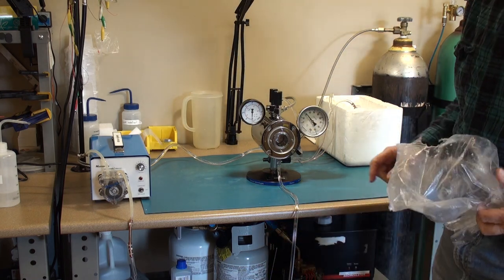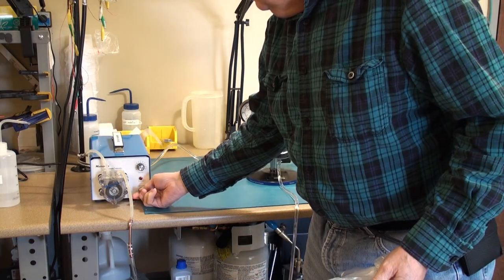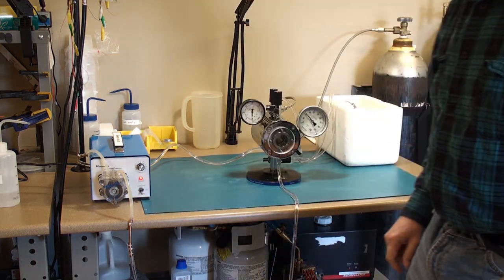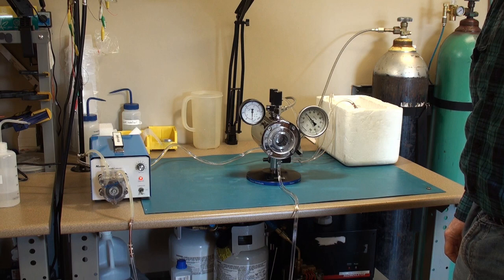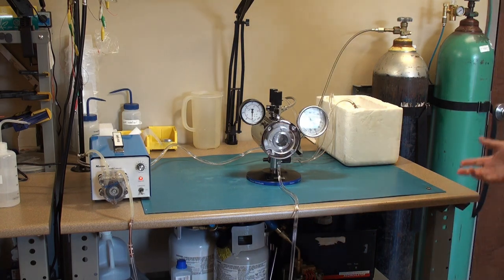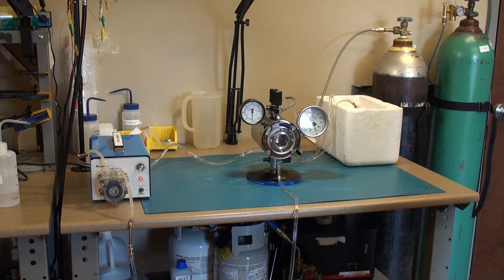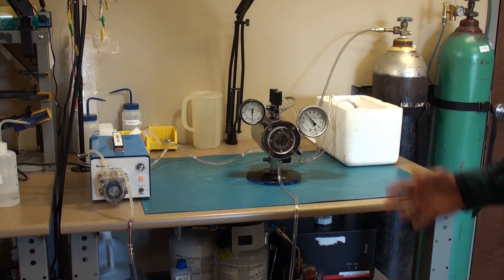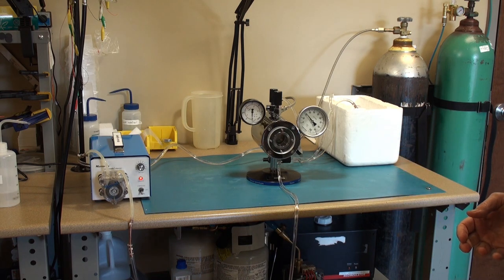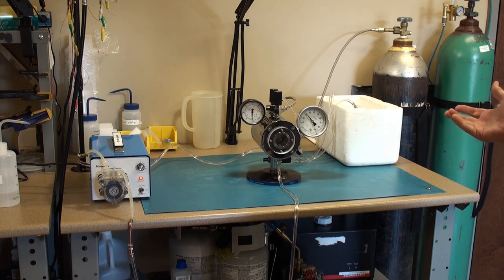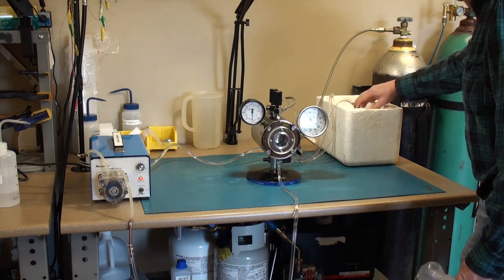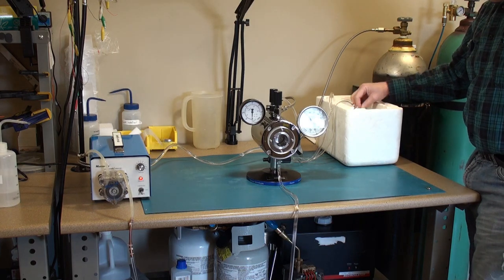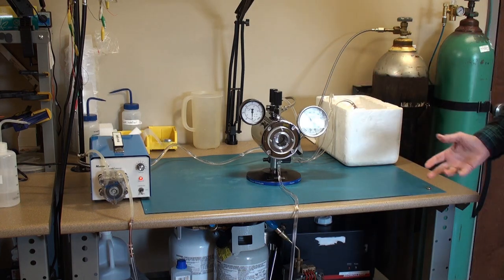Okay the ice is in the bucket and we'll begin to cool the heat exchanger. So I am starting the cooling process now. This will take some time depending on your setup and how efficient your cooling system is. This system is not terribly efficient. However it serves my purpose.